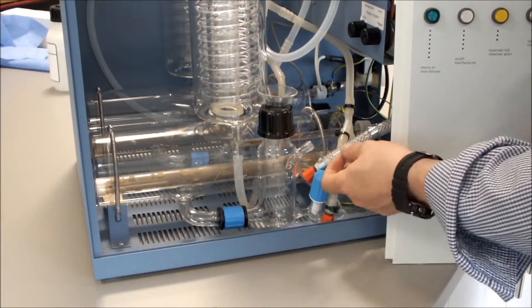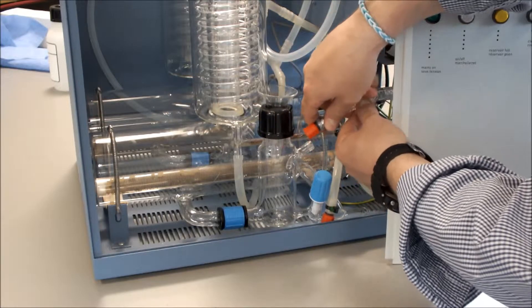The next thing is to connect our deioniser pipe assembly to our boiler control.